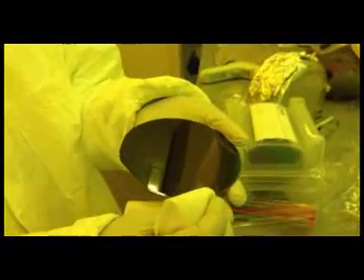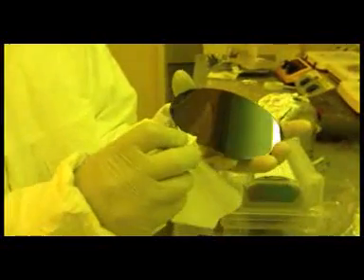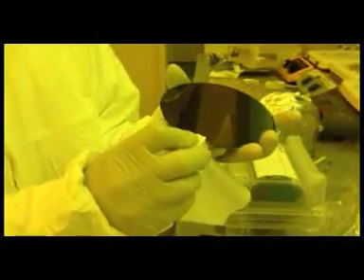Now we're going to do an edge bead removal. The simplest way to do an edge bead removal is to carefully use a clean room wipe to wipe the circumference. Then soft bake the wafer. First, bake at 65 degrees for 2 minutes and then 95 degrees for 5 minutes. Then take the wafer off and let it cool. Using your tweezers, carefully test the edge of the SU8 on the wafer to make sure it is no longer soft.